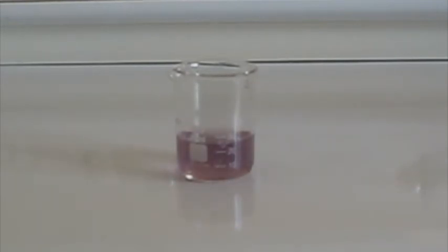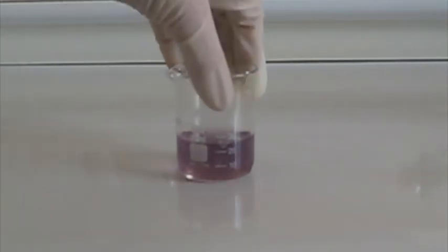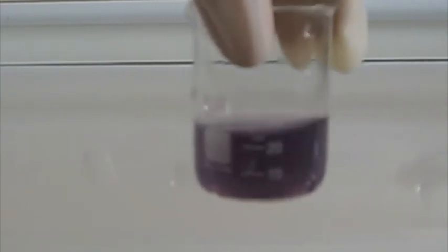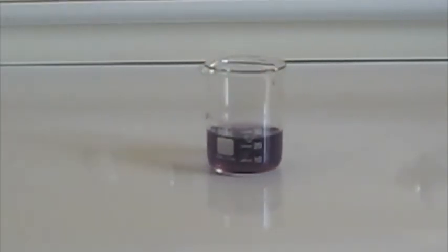This is different from most iodine clock reactions, which immediately turn black instead of slowly get darker. You can see it's now blueish, blackish, purplish. A lot of ish colors.